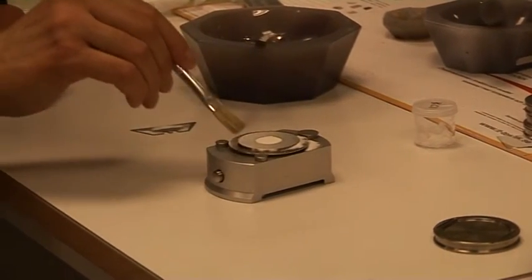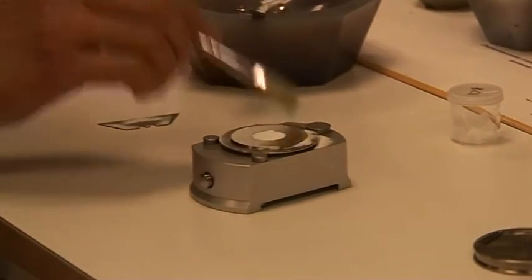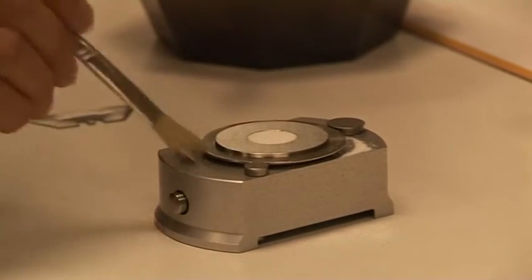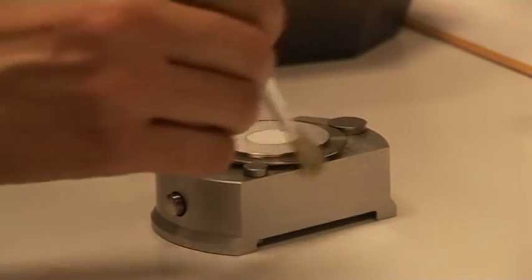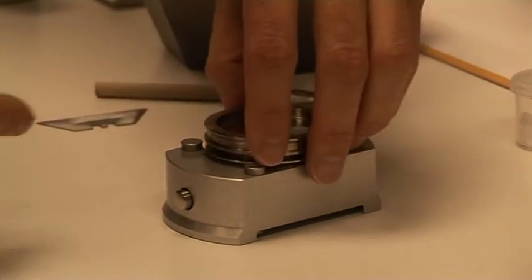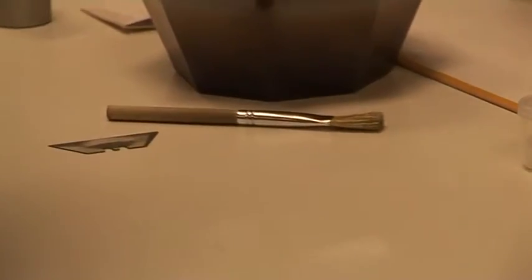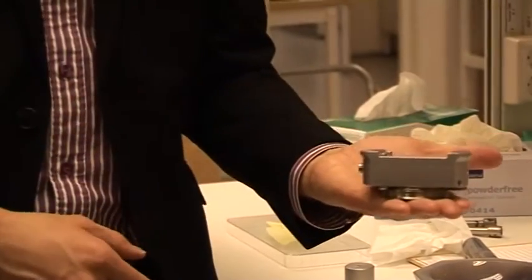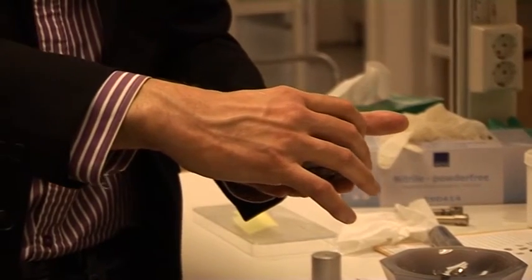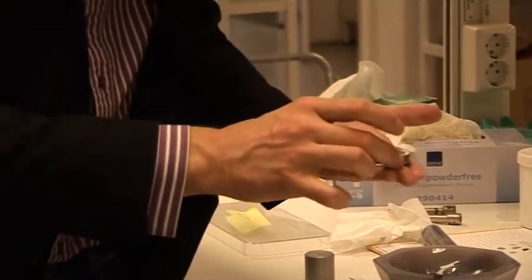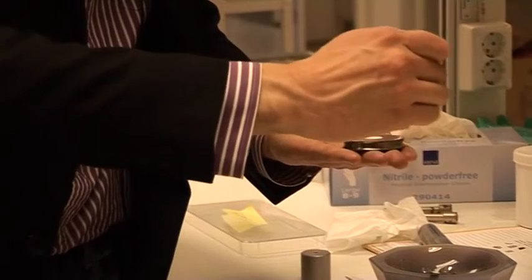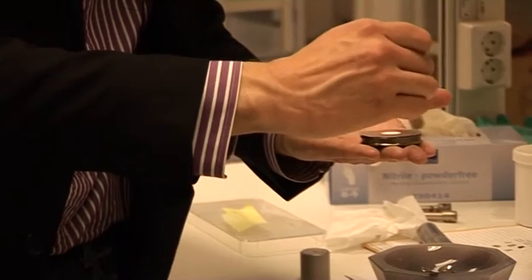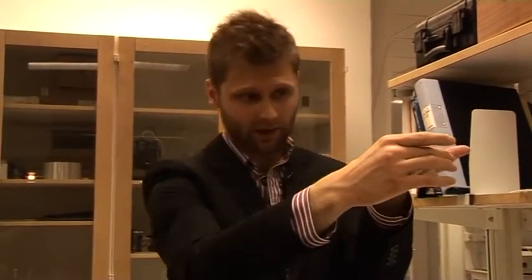Then we take a brush and clean it a little bit. I think this is important to have it clean so we can close it nicely later. I'm going to take the bottom part and then just close it. Then it's very important to first flip it over like this and have it on your hand, and then press this knob to loose the sample. Our goal is to get this surface as flat as possible and as even as possible. I think it looks fine to me.